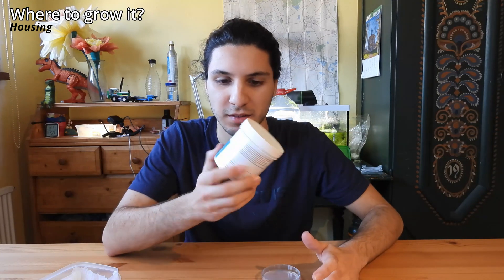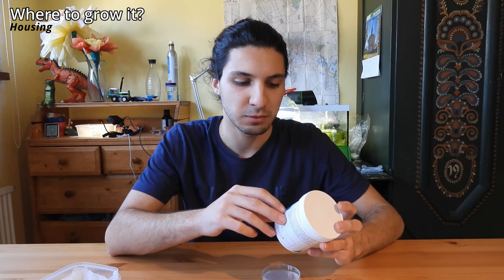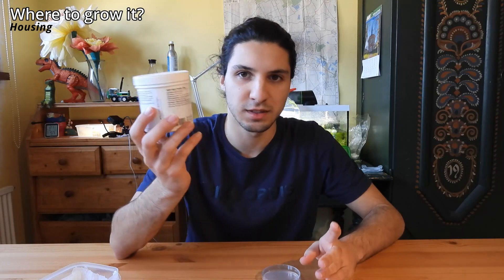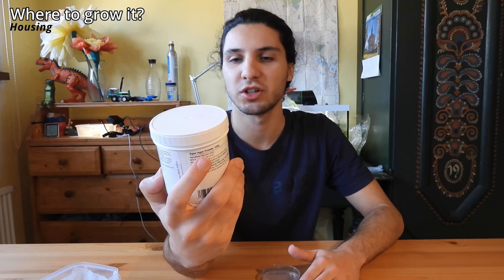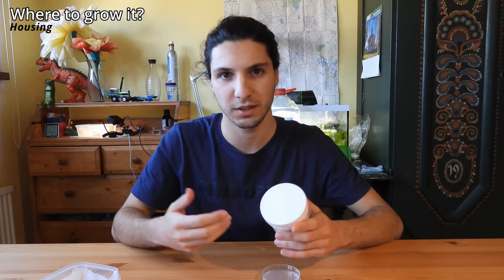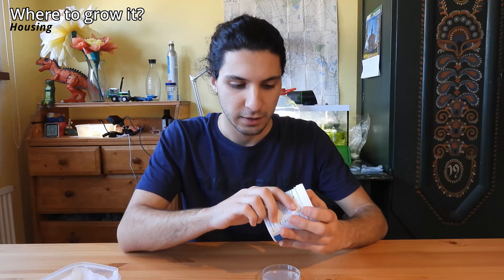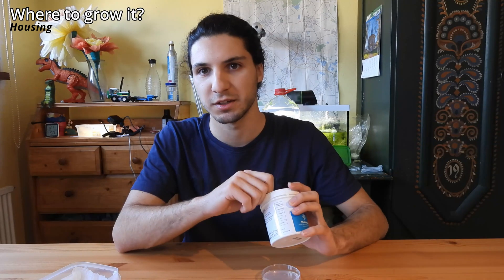The disadvantage is that you have to buy it, so it is a bit expensive, but not too expensive. With the vegan movement and all the different vegan products, this is safe to use and completely edible. What I have here is a vegan gelatin replacement. If you want to find it in your grocery store, look for it in the vegan supplements or vegan ingredients section. You can also find it on Amazon with different products from expensive to less expensive. If you want to make some experiments and film it, I would recommend getting some agar plates.